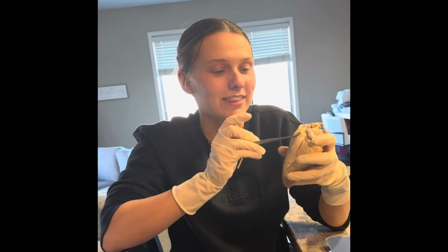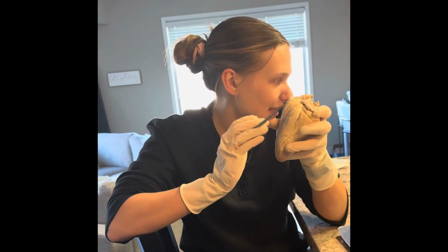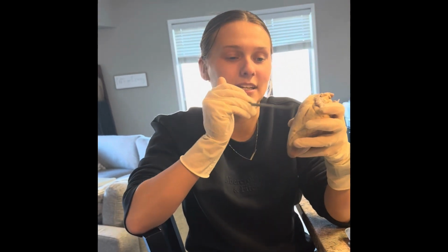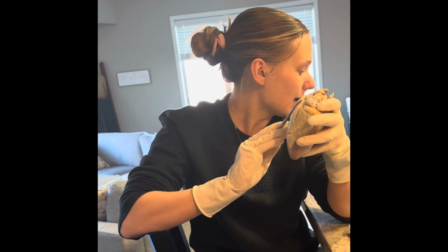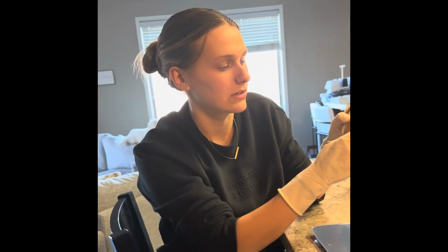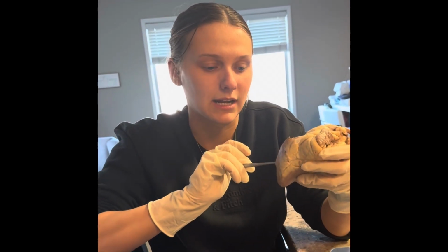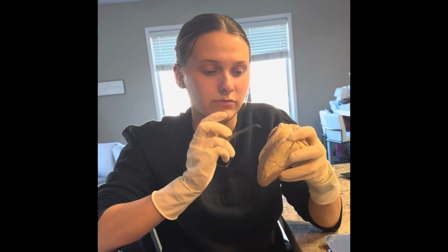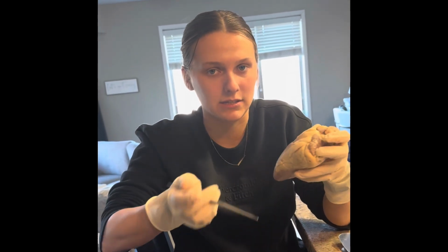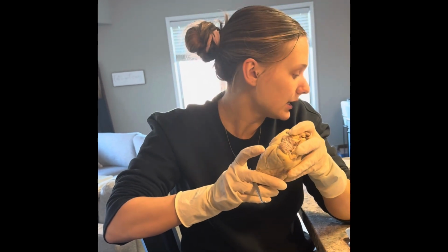Okay, so the next part that I'll talk about is the base of the heart, which is right here. And that is the attachment for all of the blood vessels that are in the heart. The next will be the bicuspid valve. So that's gonna be right in here. It's called the bicuspid valve because it has two parts to the valve. And then the next will be the tricuspid valve, which is found up here. And as the bicuspid valve has two, the tricuspid valve has three.